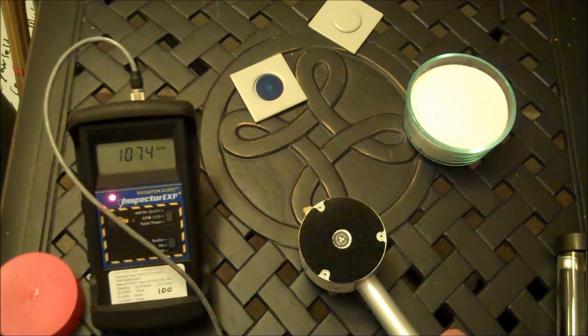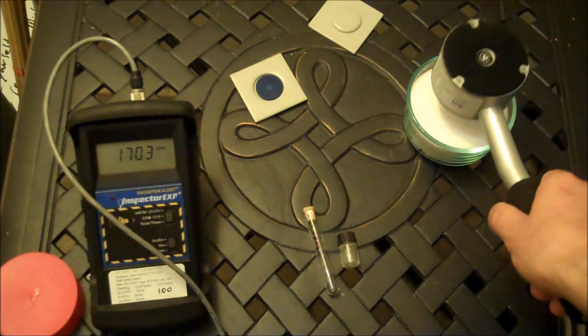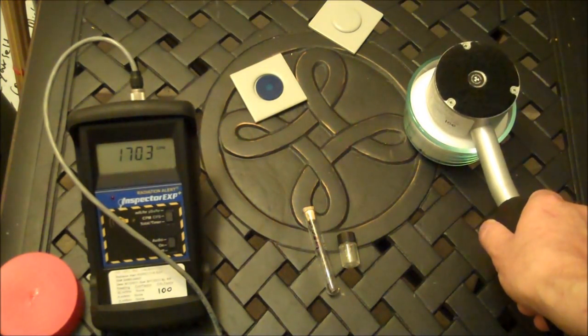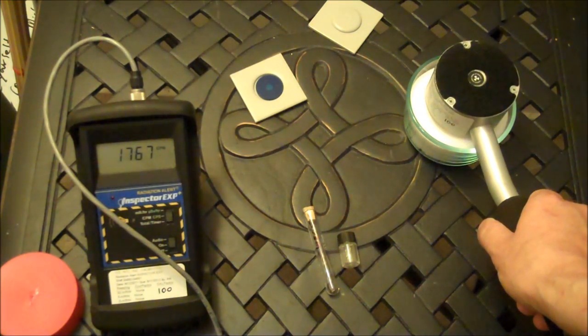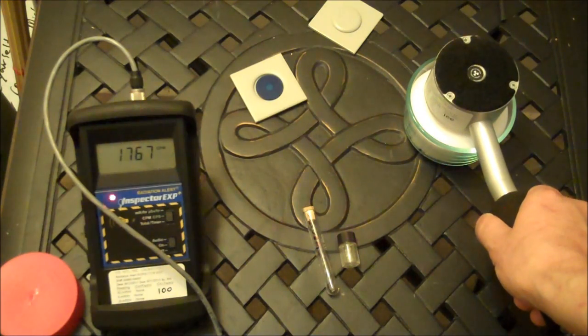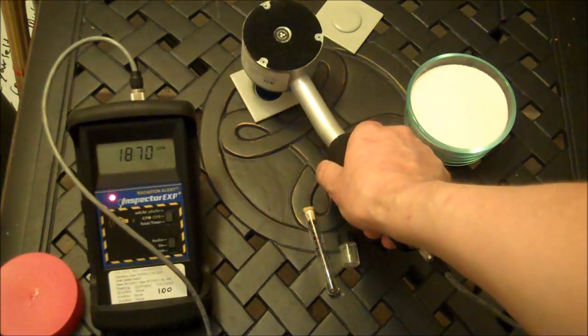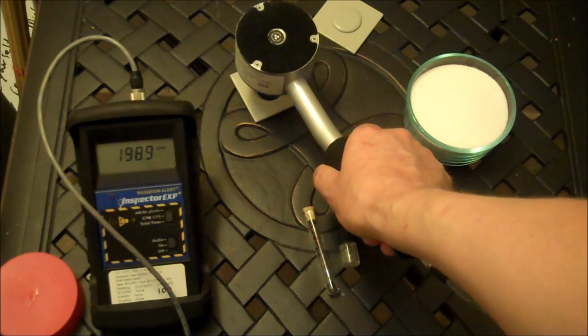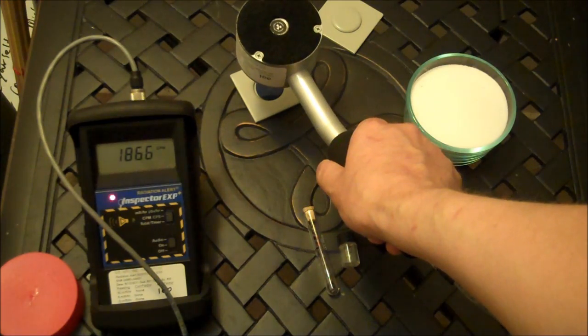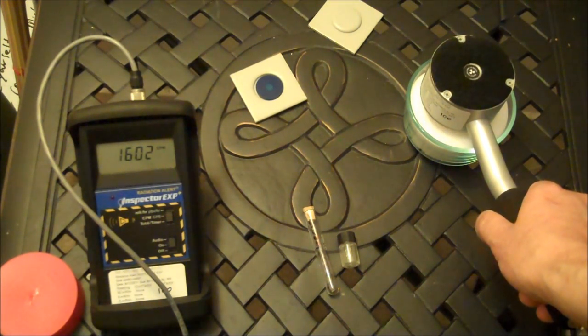Surely, there'll be a difference. Now the potassium salt. Just clicks. And now the cesium-137. It's hotter, but if you hold it back a little bit, I trust you get the point.